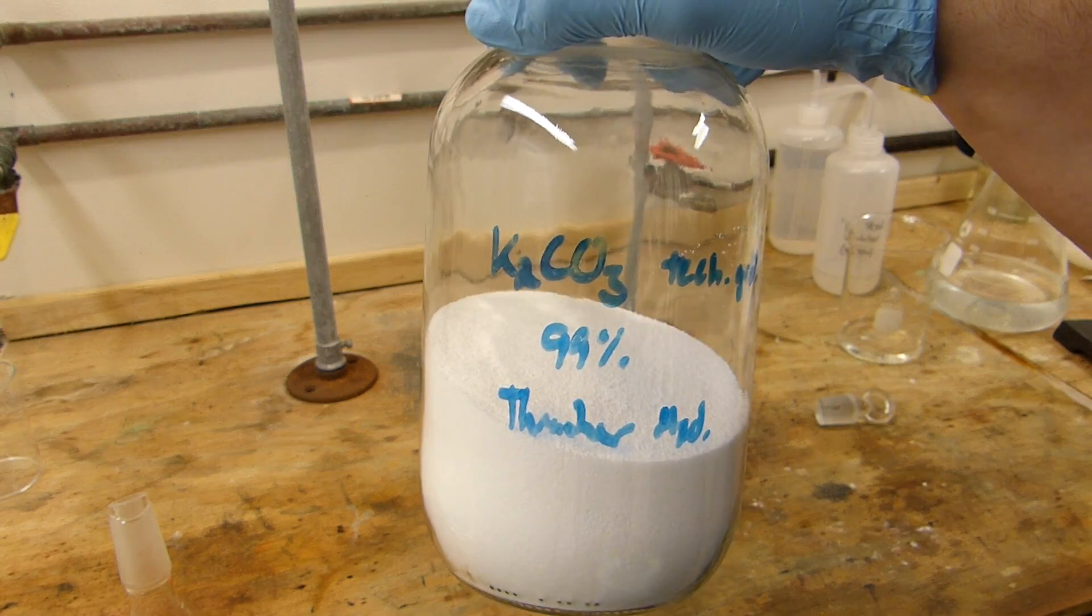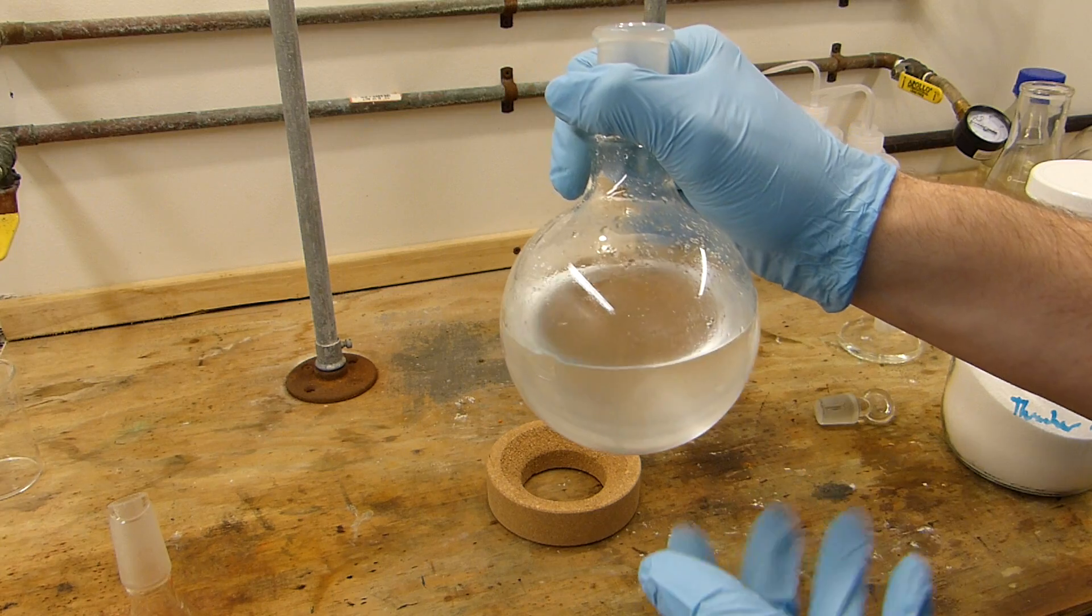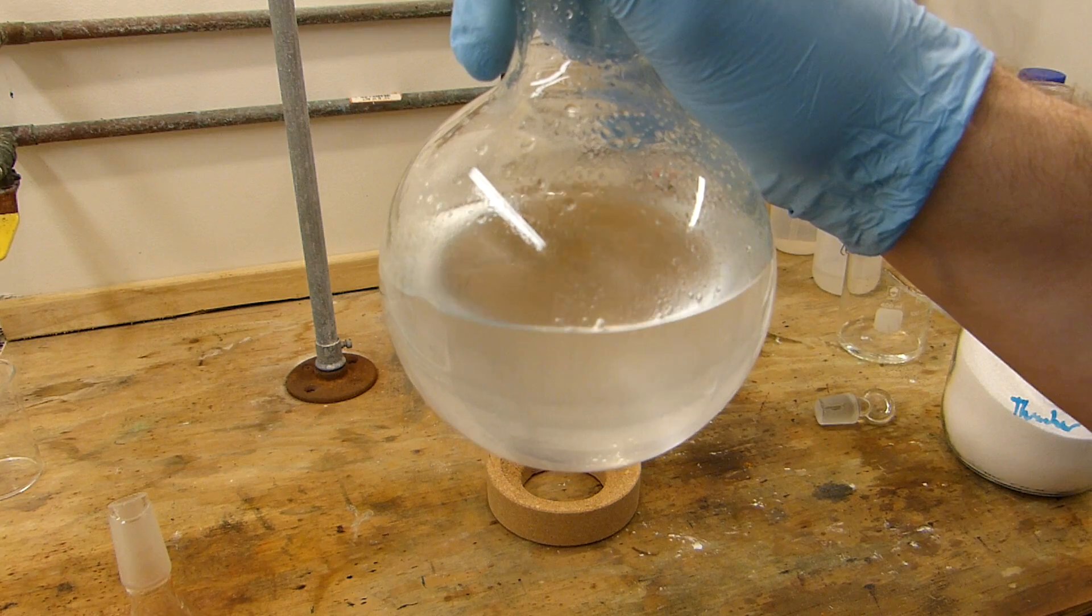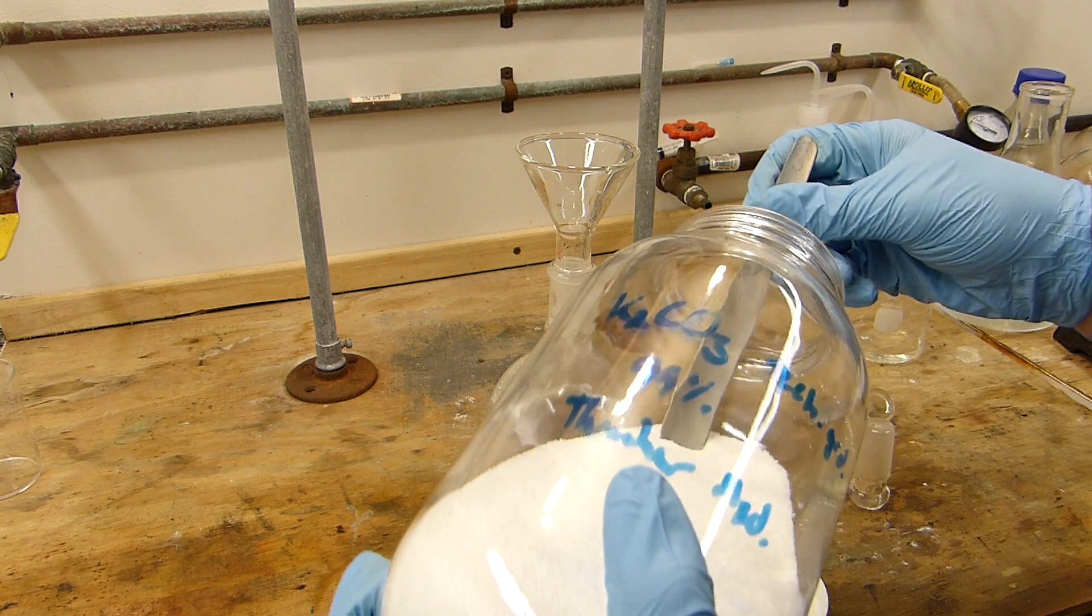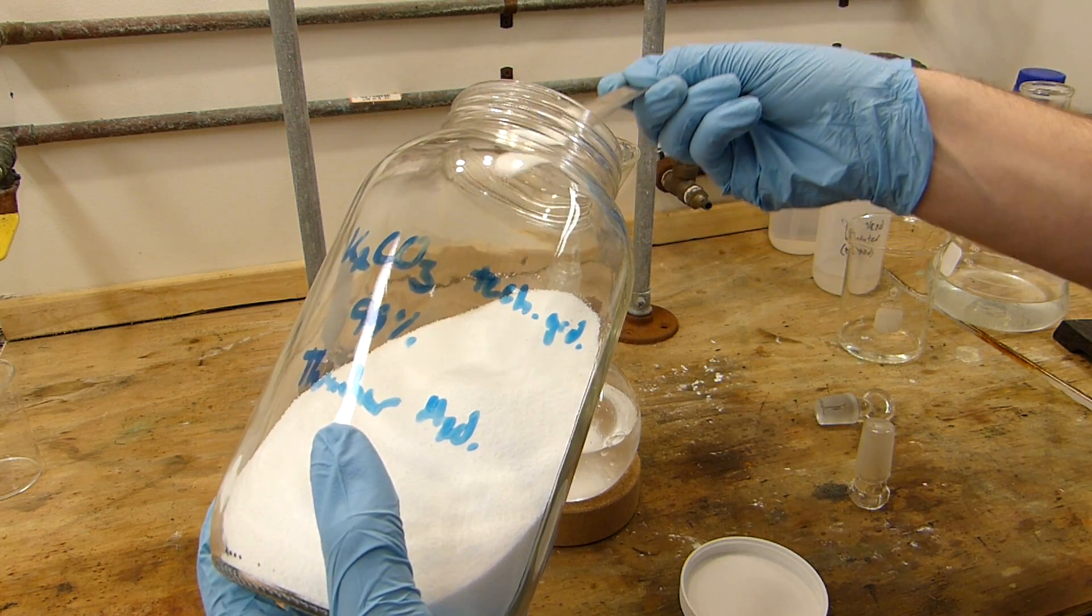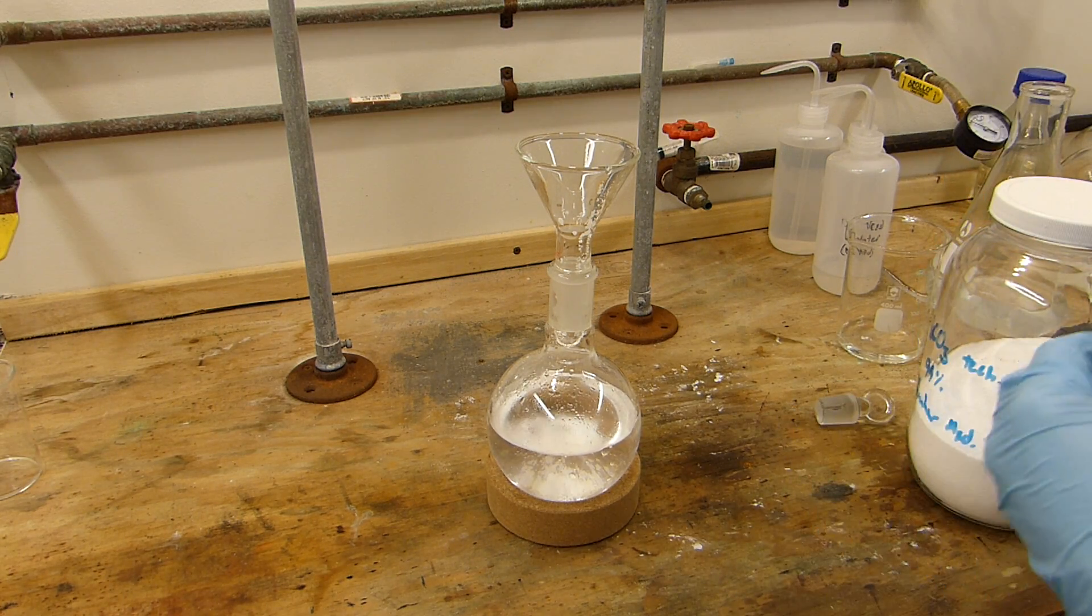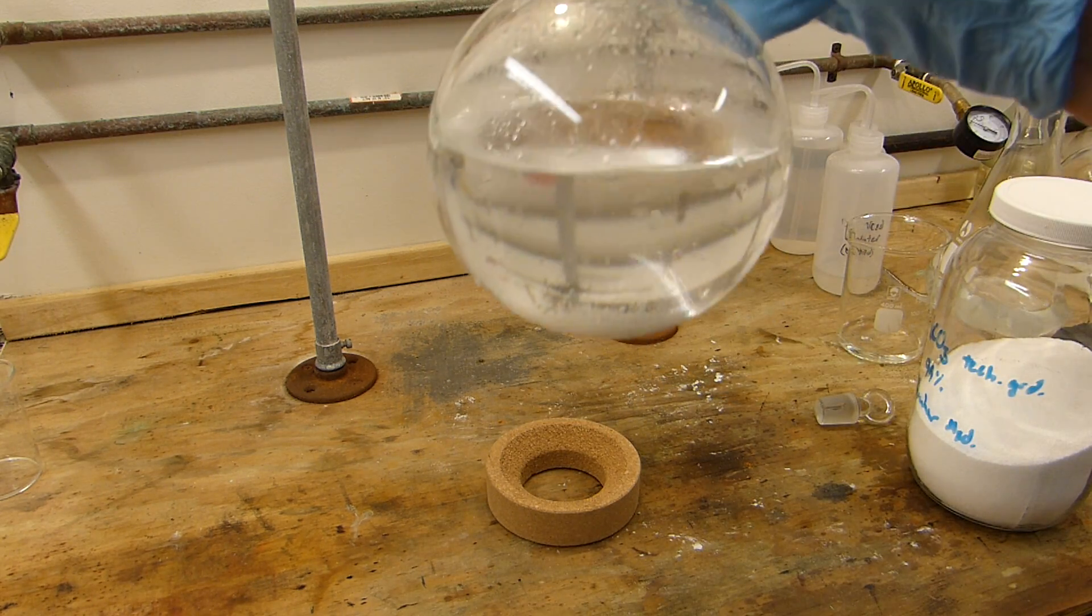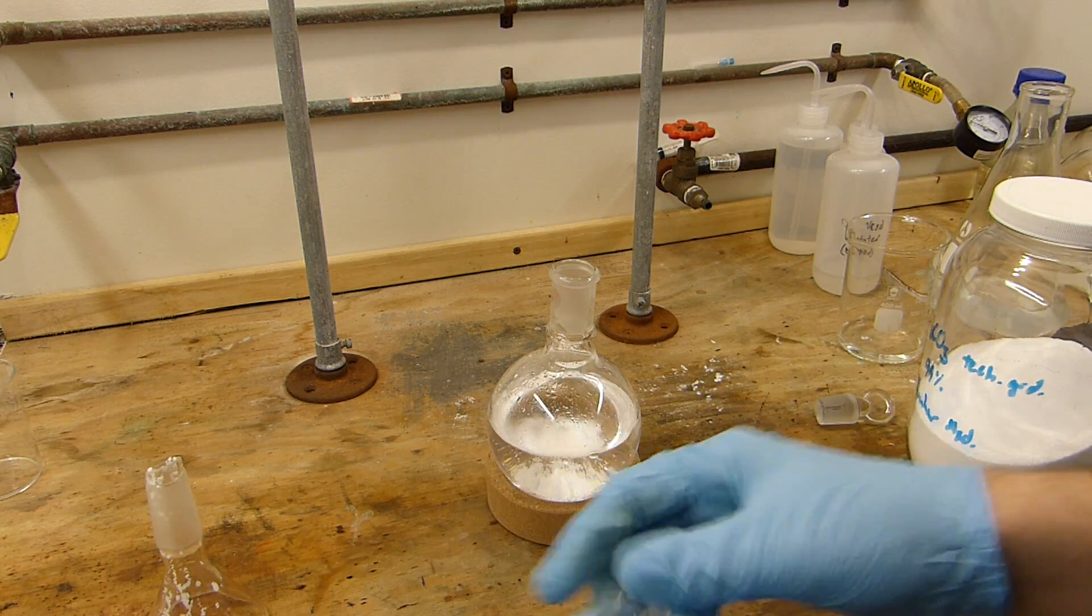We're going to do that with some technical grade potassium carbonate. So all I'm going to do is add a few spoonfuls of potassium carbonate to this and I'll shake it up and it's almost like a magic trick where this will go from cloudy to clear in a couple of seconds. I can already see it's clarified, but you can see now how much clearer it is already, but I'm just going to shake this around again, venting often.